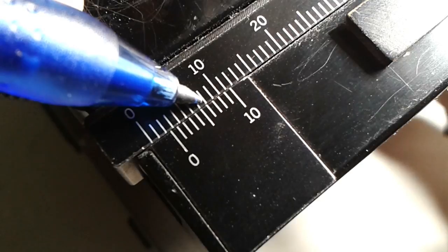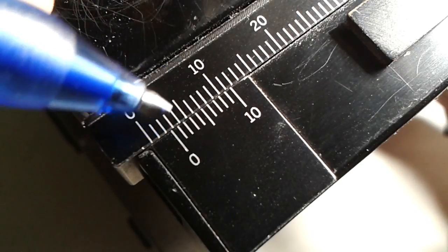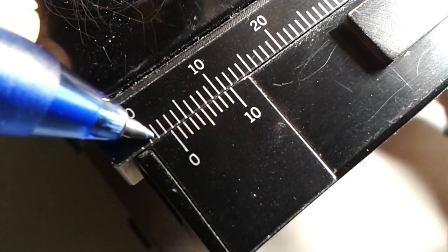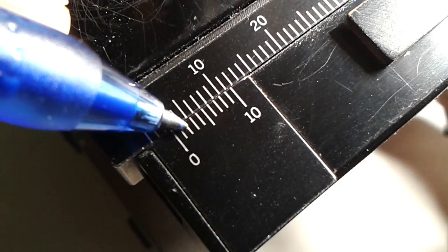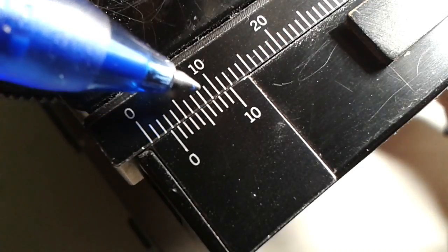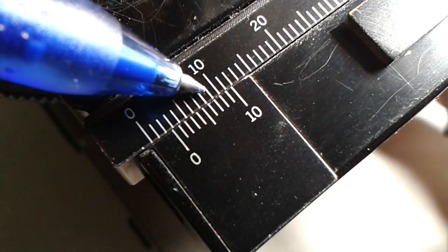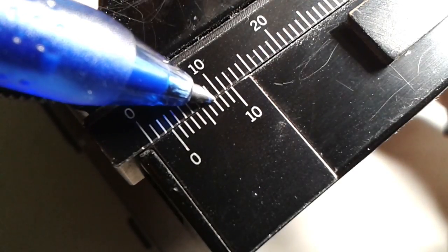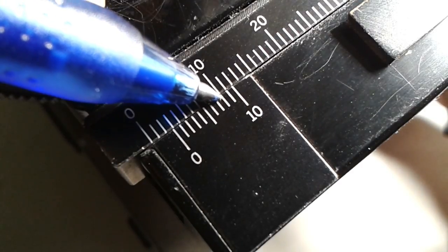Now this is 2.6. Now you can see that the sixth line is lined up. You can see it's a little bit further than the half, a little bit more than the half, so 2.6 makes sense. If we move it yet a little bit further, then it's now 2.7. You can see that the seventh line is lined up. So we're always moving it by one tenth of a millimeter.